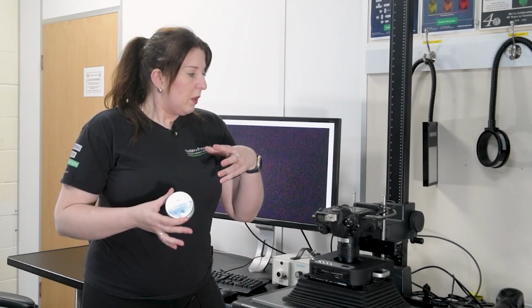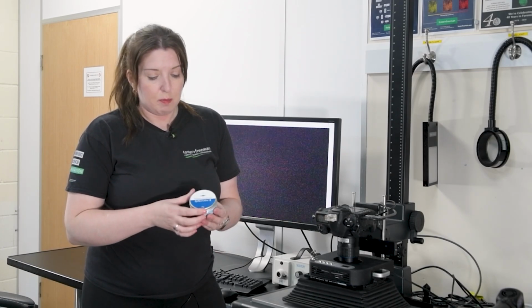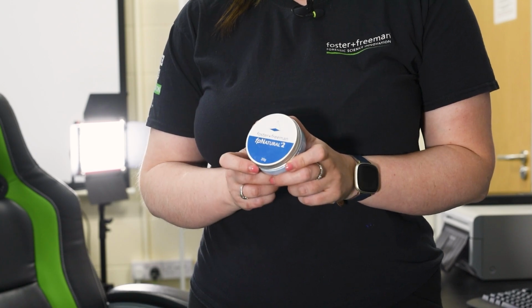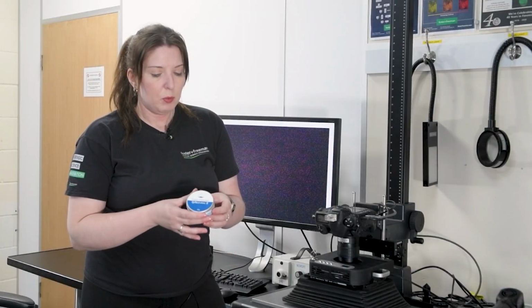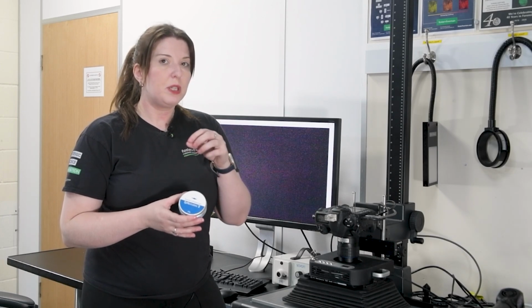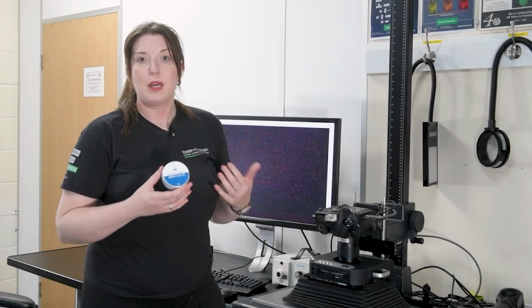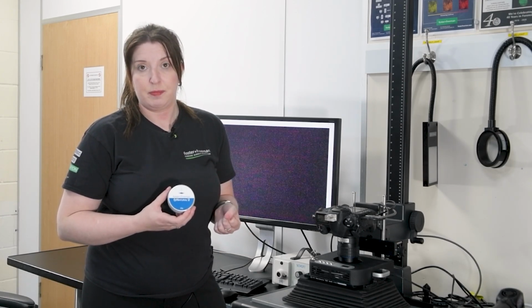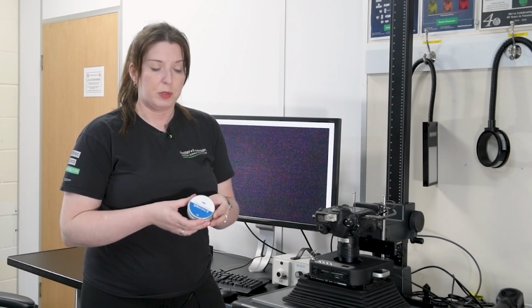Now, if you're not able to use powders on your banknotes, or maybe you want to try something else first, then we have some other ideas. The first example is actually going to be our FP Natural 2 powder. Now, I am going to say the word powder here, which I know I've just said, that powders usually come last in the process. But powders can also be used in another way. If you have something treated with cyanoacrylate, we can powder on top of the cyanoacrylate. And that way, maybe if we want to try something else, we can remove that powder afterwards.